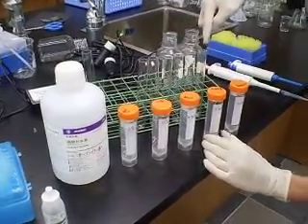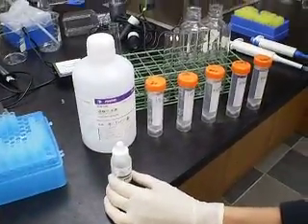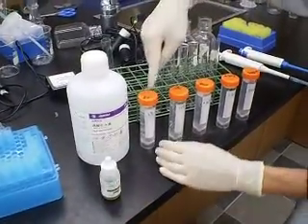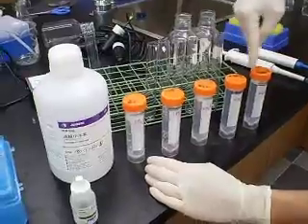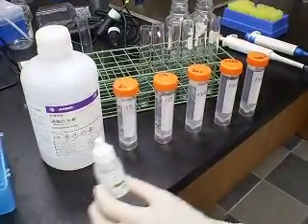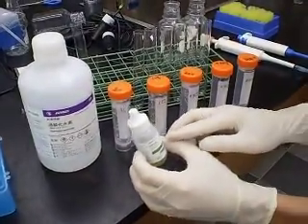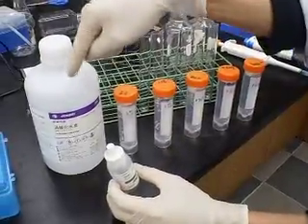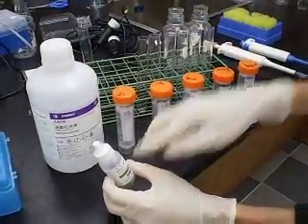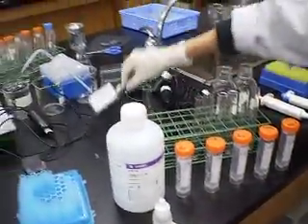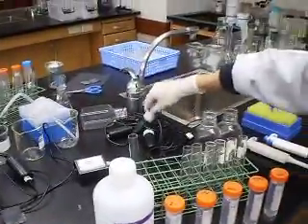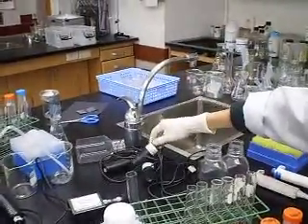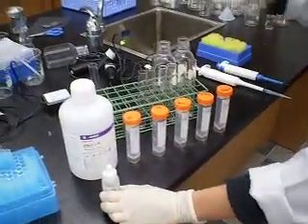This is my enzyme. So the research question is how will changing hydrogen peroxide concentration affect the rate of oxygen gas production between hydrogen peroxide with catalase. And you're going to measure it using sensors: gas pressure sensor and oxygen sensor which I will demonstrate in my second part of my video tutorial.